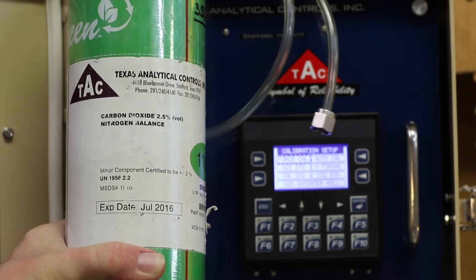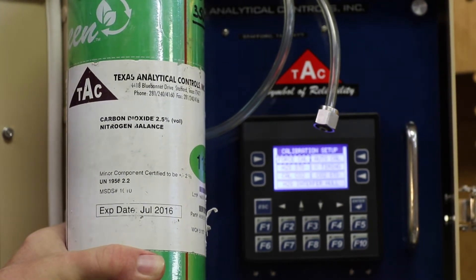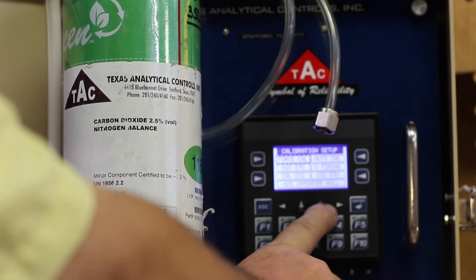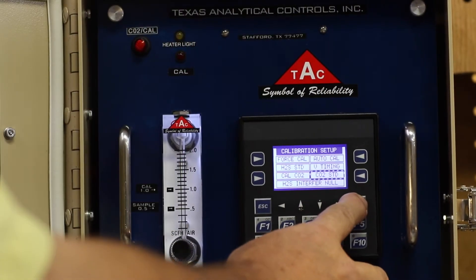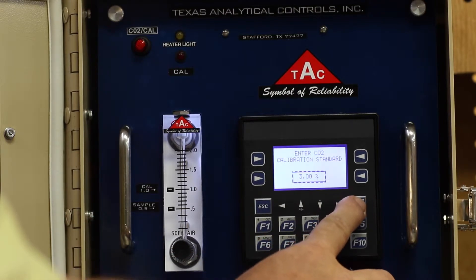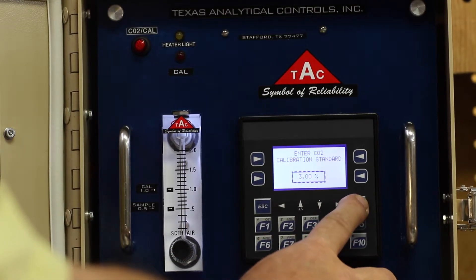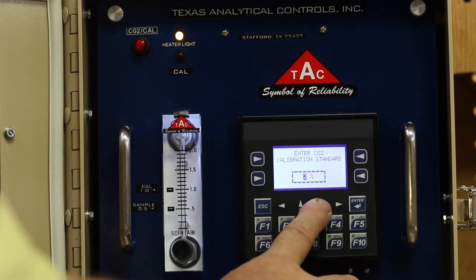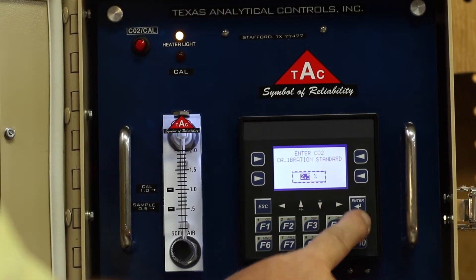Today we will be calibrating with 2.5%. You go to F5 and scroll down to CO2 standard. This analyzer is set up for 3%, so we want to change that — hit enter, then type 2.5 and hit enter.